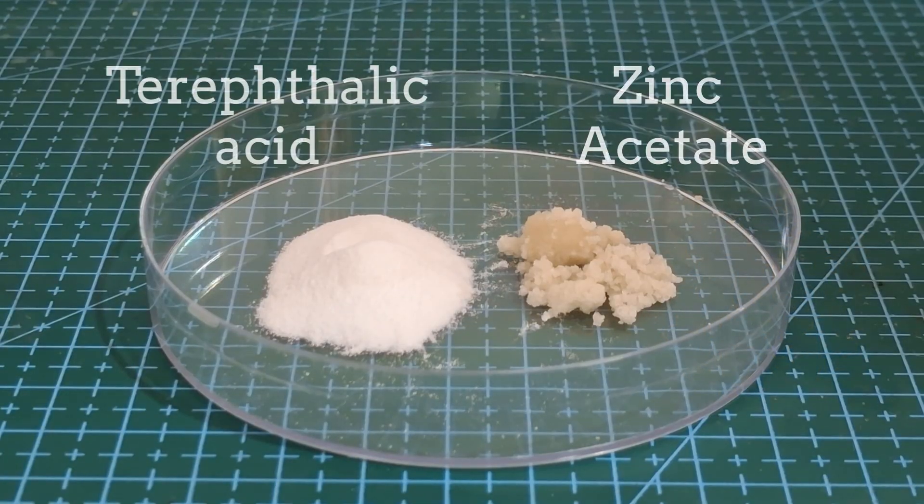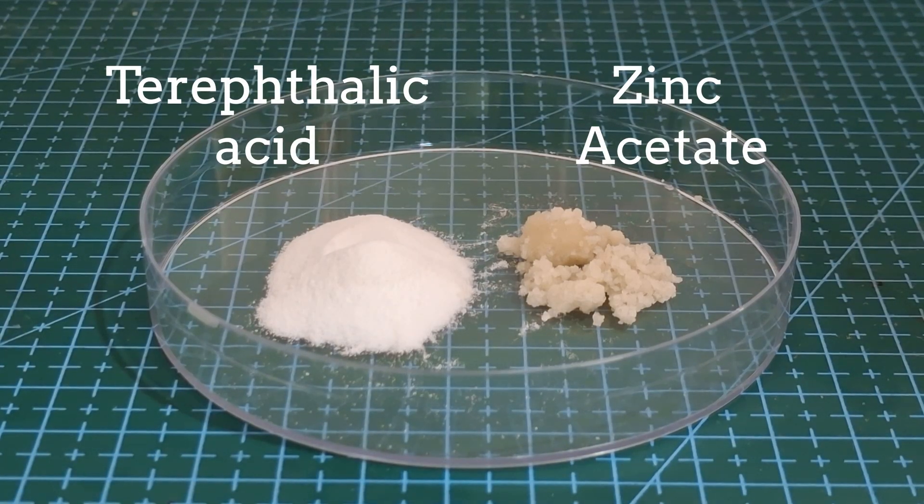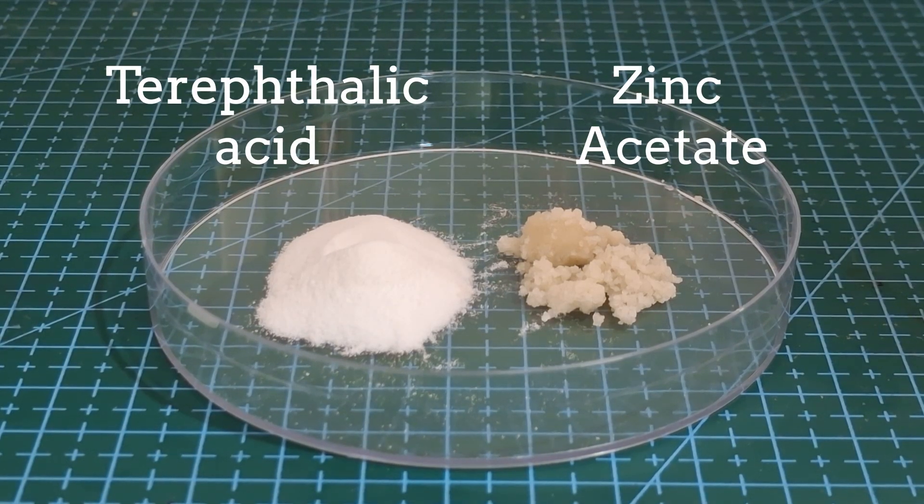Our main reagents are terephthalic acid, a dicarboxylic acid that's the monomer of the plastic polyethylene terephthalate, and a zinc compound like zinc acetate.